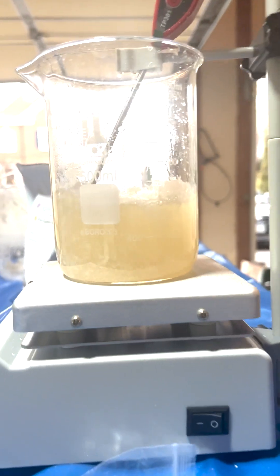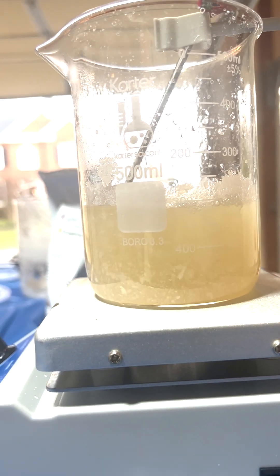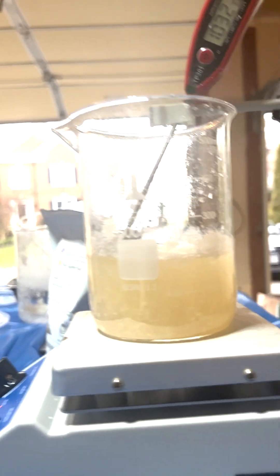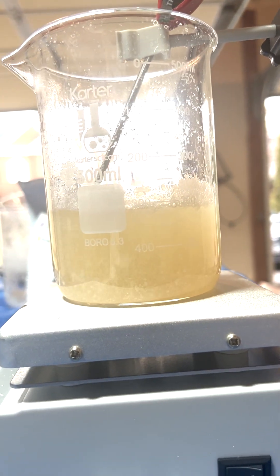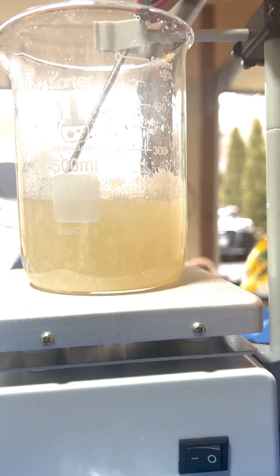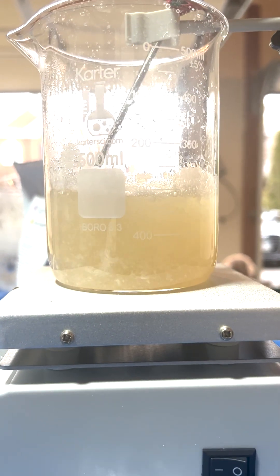As you can see here, it's starting to get cloudy. This is like five minutes later. We have to open up the garage, because it gives off a very pungent odor, and hopefully more crystals start to form pretty soon.